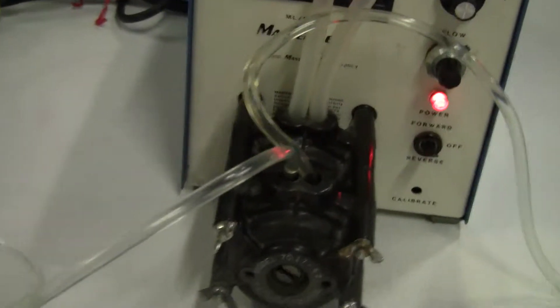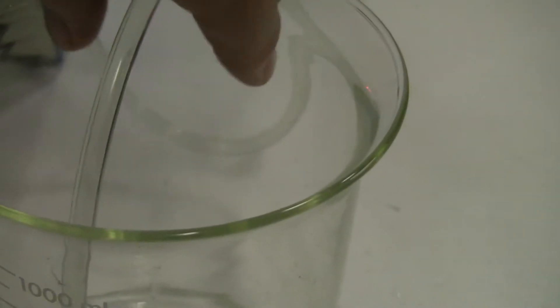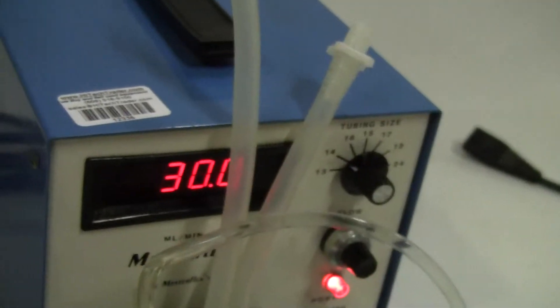I just have the first head hooked up at the moment. You can see it pumping. It's getting ready for flow.